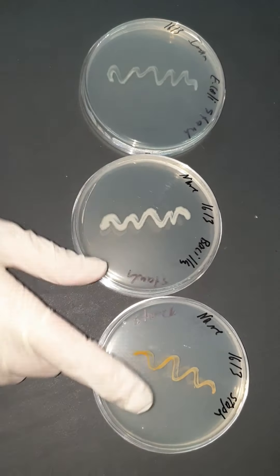Now I will add iodine on those petri dishes to detect if the bacteria has digested the starch or not. I will flood the area around the colonies with iodine and wait for a few seconds.